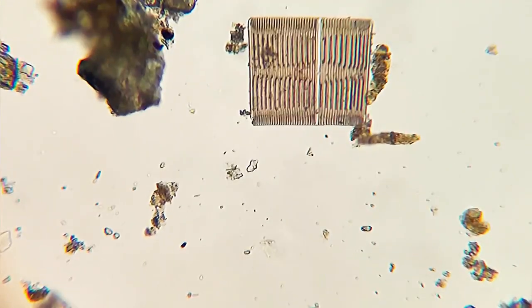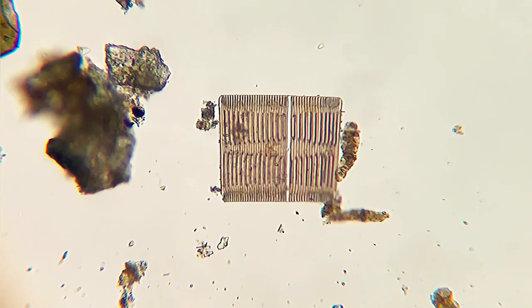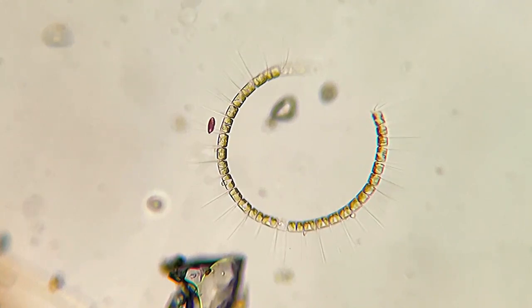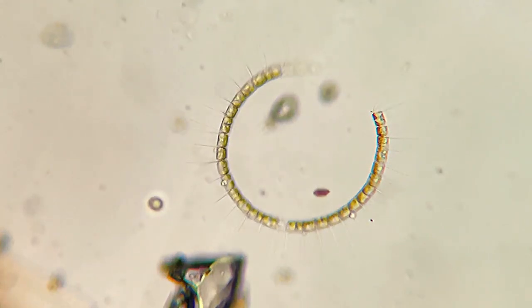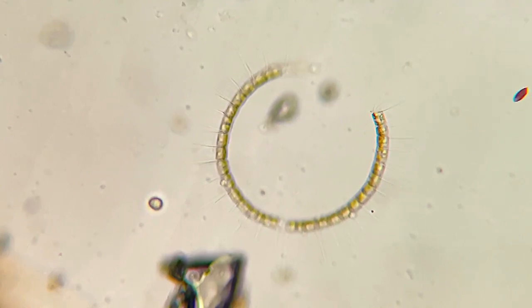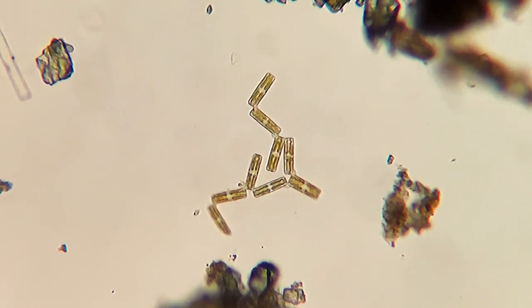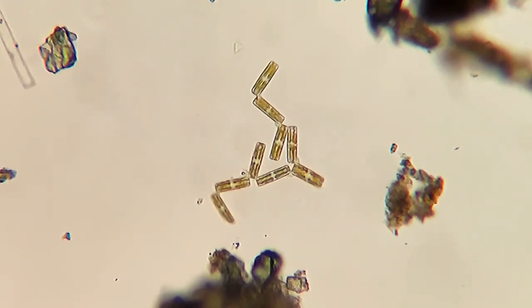This is a different species of diatom. But this one is actually a colonial diatom, just like this one over here. This is another colonial diatom.